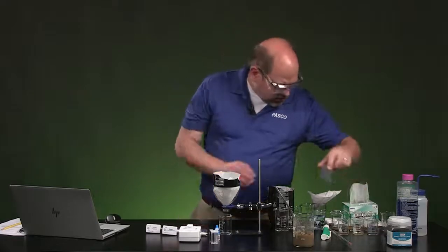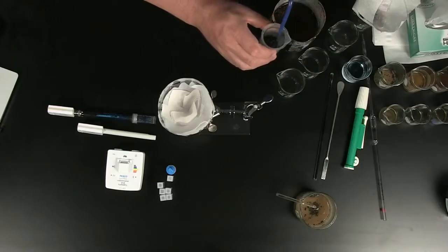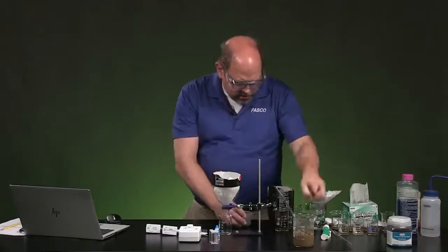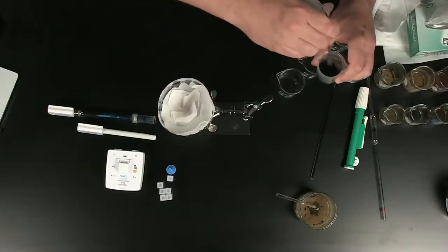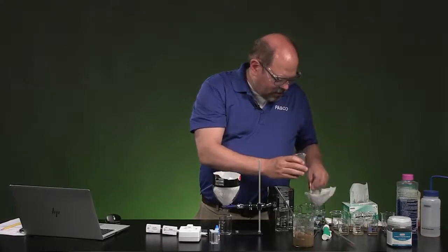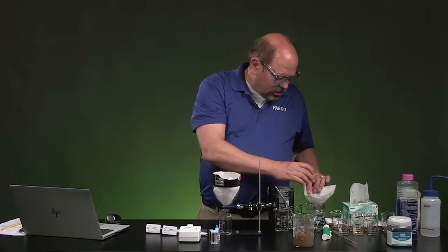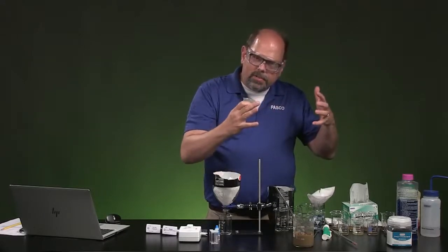Basically, what you're going to do, here I'll show you, as a setup part, is take this, add some water to it, and stir that in there. So it's suspended. It looks really dark. And again, I've done this before to save a little time. You're going to make a little filter apparatus, and you're just going to pour this into that filter so it impregnates or gets stuck in the sides of the filter itself.